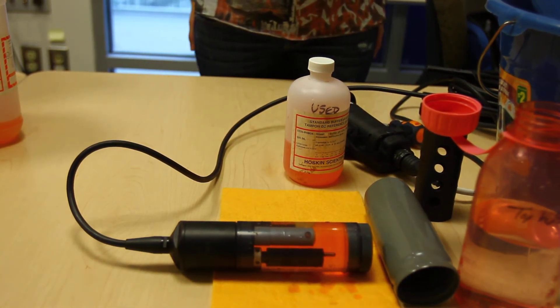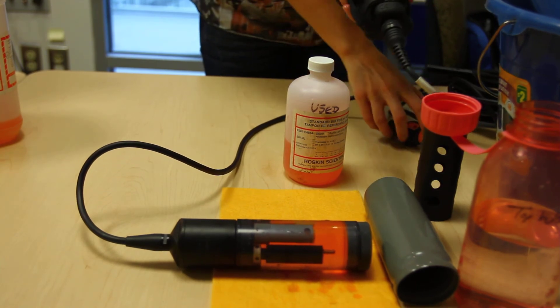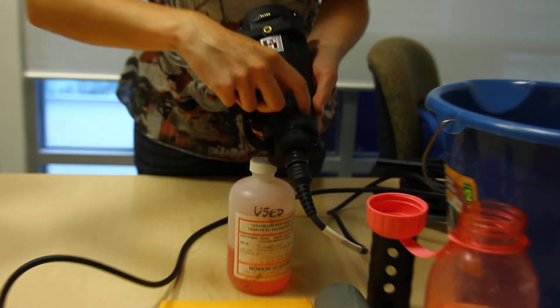For long-term storage, you will also want to remove your batteries. These are the screws found in the center of your unit.